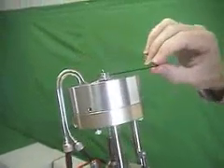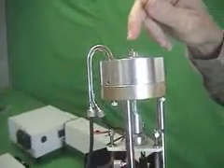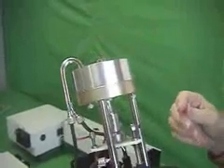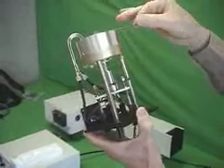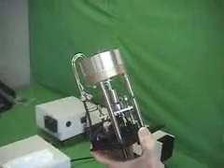If you really tighten it up, there's a danger that you're putting too much stress on the lamp. You can stress it and break it, which would cause an explosion of the lamp. So you just want thumb and forefinger pressure to turn the Allen key, and that is sufficient.